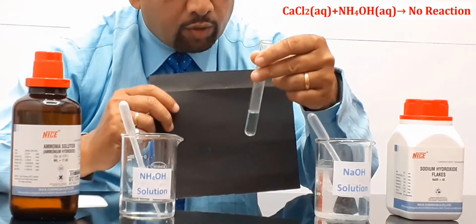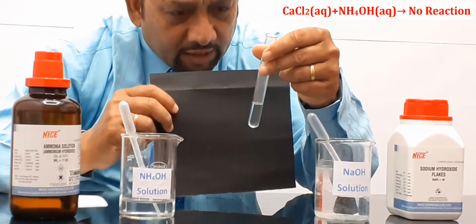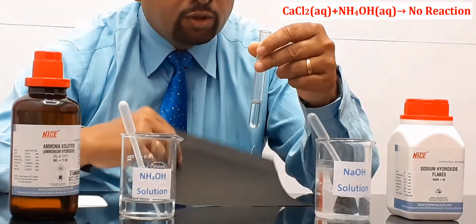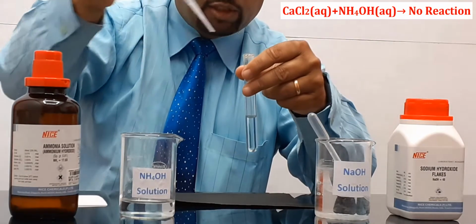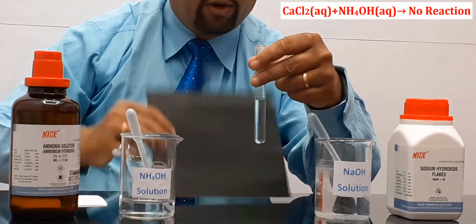Okay, so no white precipitate forms, or maybe a very slight one. If you can observe, there are just some flakes of it, but nothing really substantial. Okay, so no clear white precipitate, and let's add excess. And no matter how much ammonium hydroxide we add, there is no reaction.